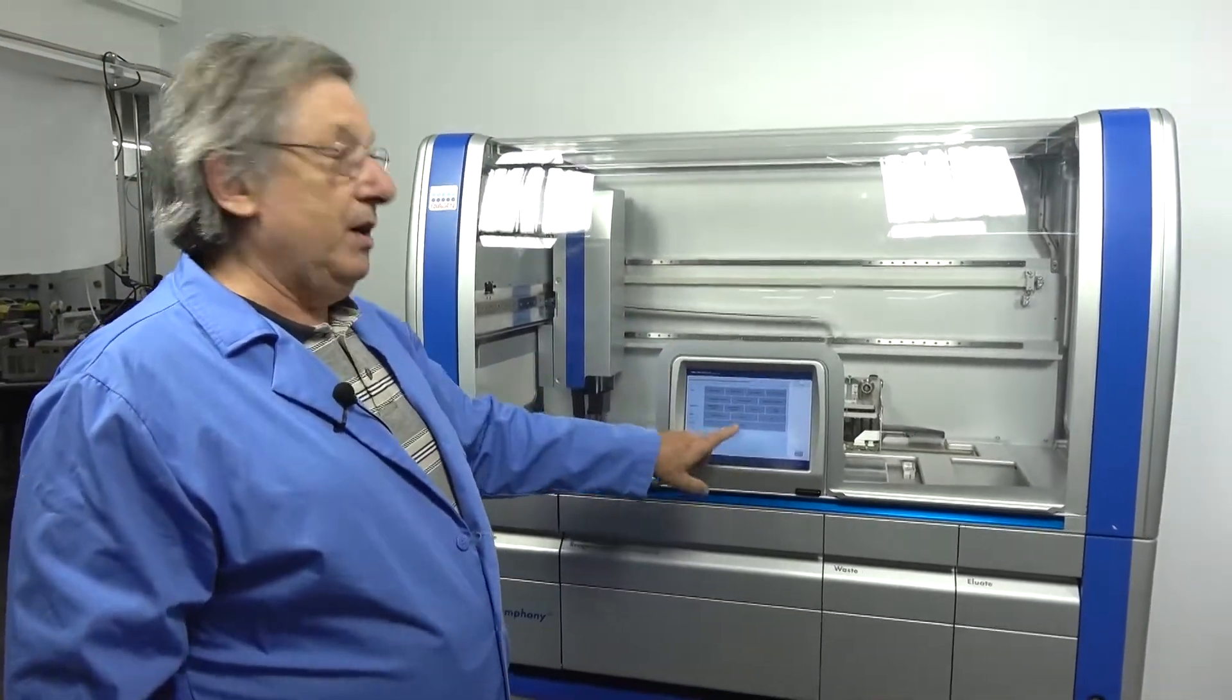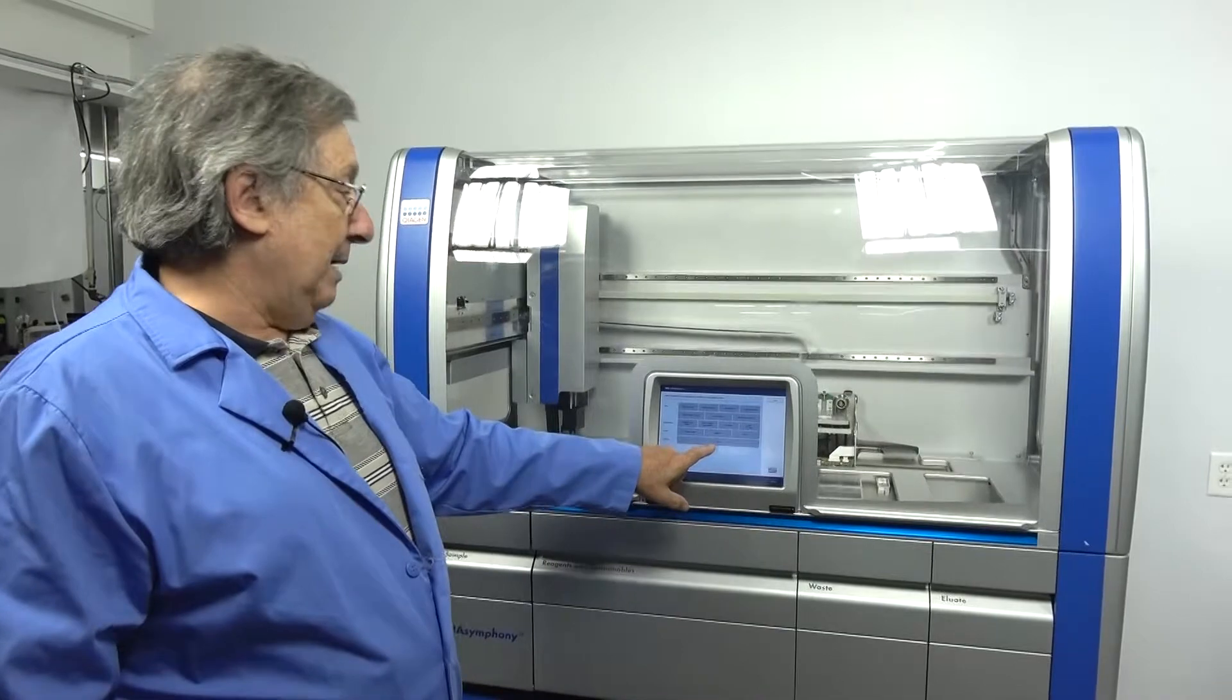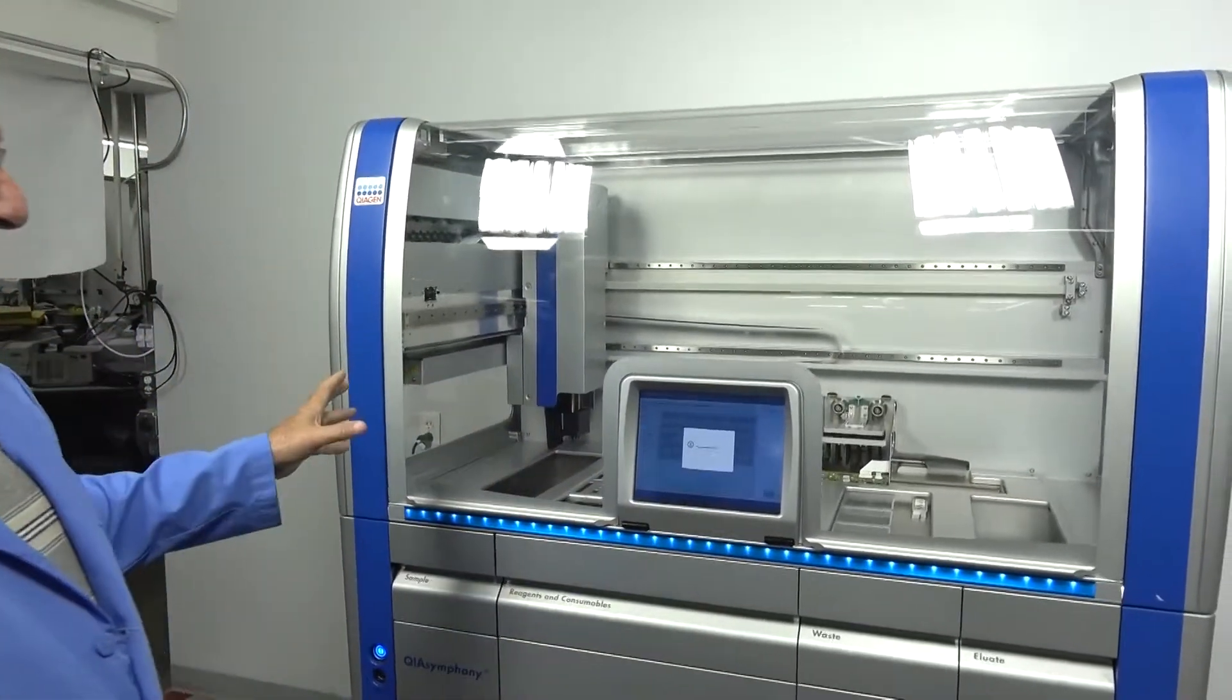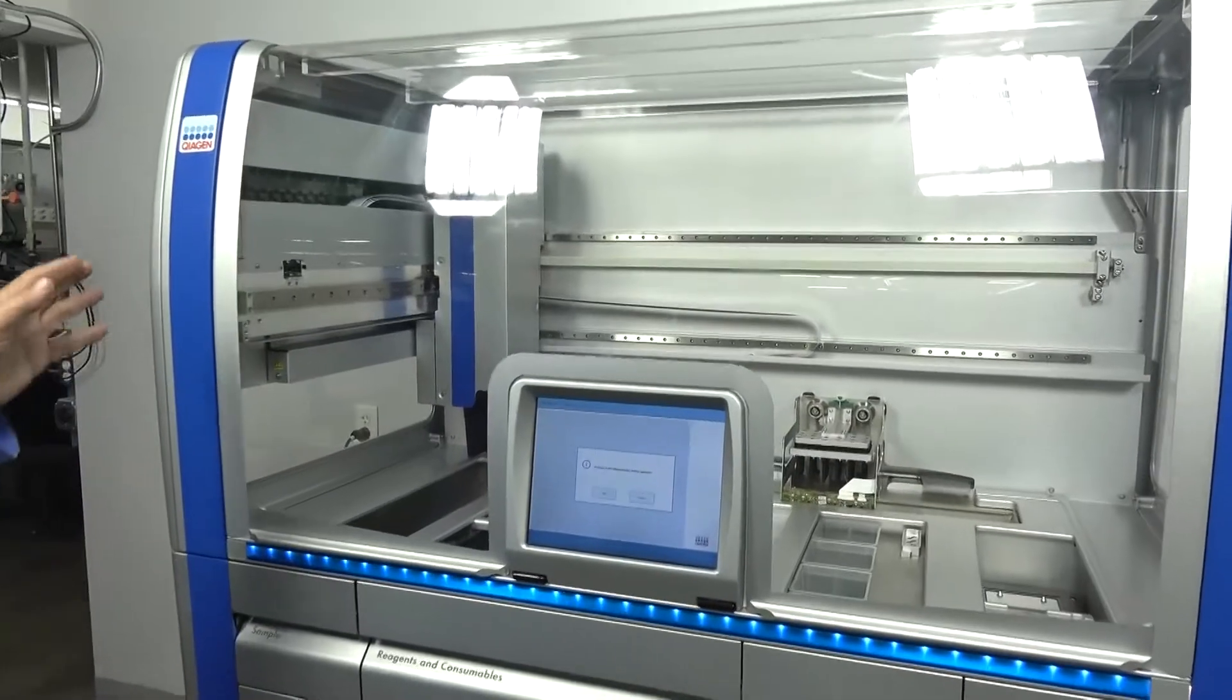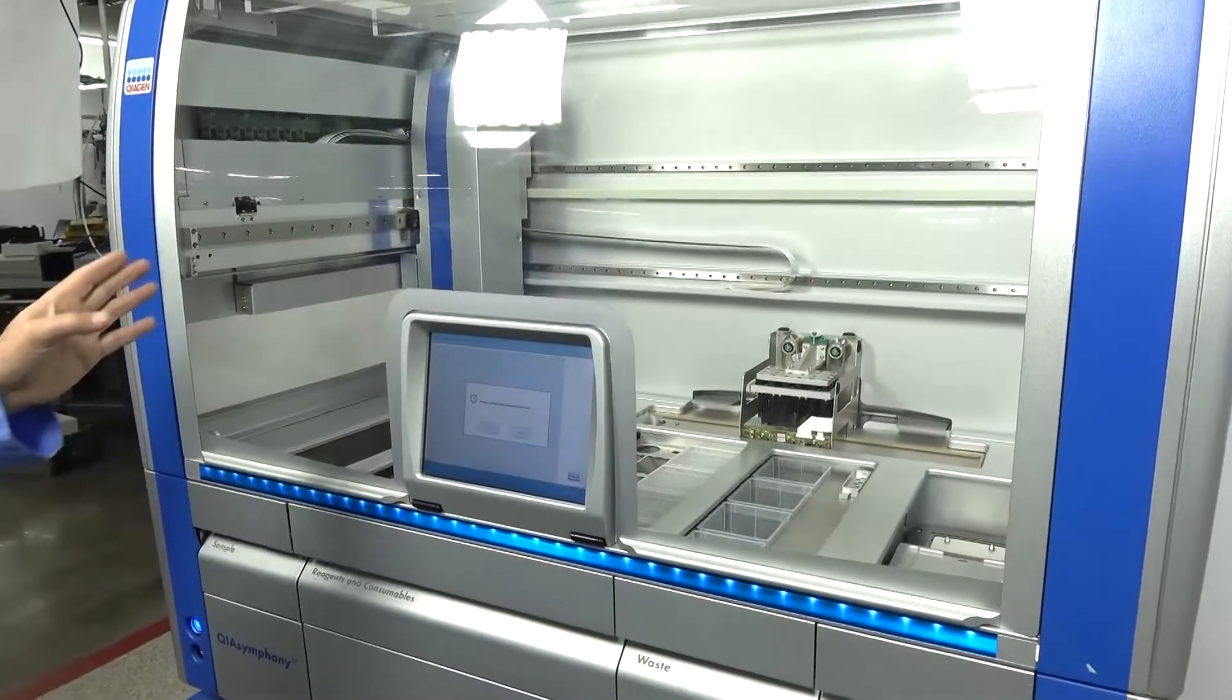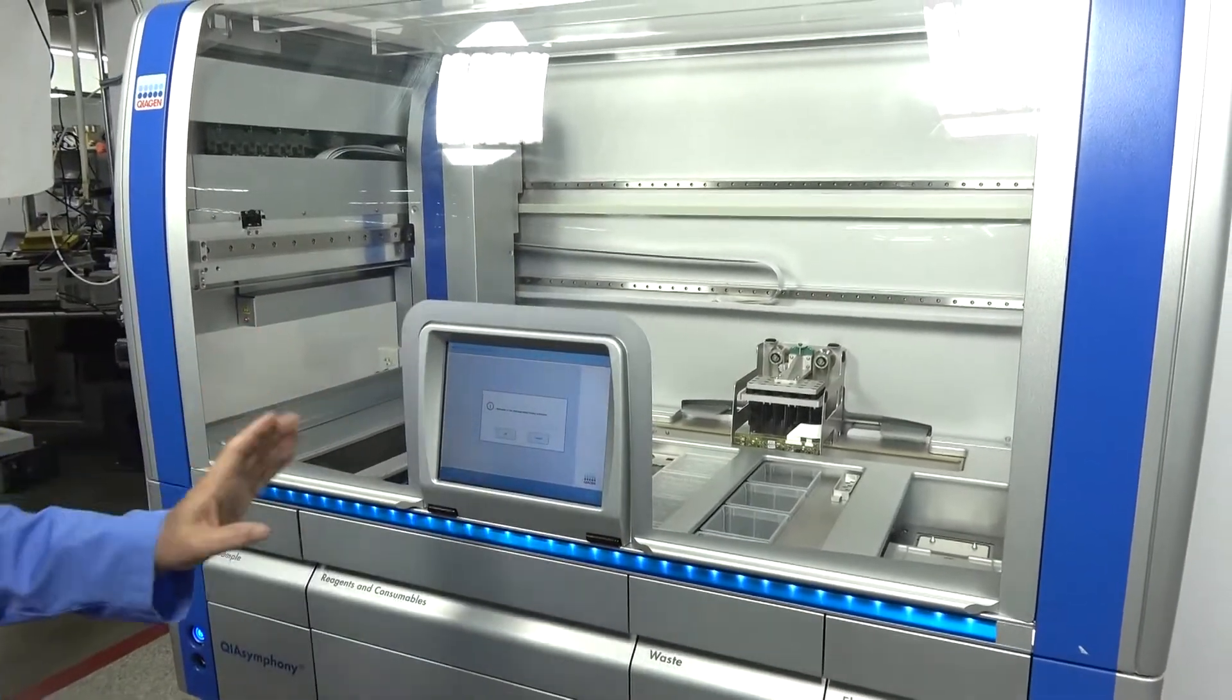One of the other things we do is run the cleanup on this. The cleanup is a lot more involved. It's basically used when you have a crash, when something didn't go right. It walks you through the procedure.